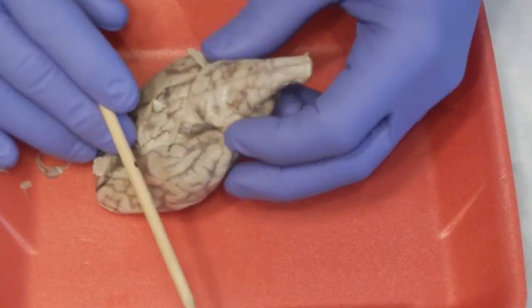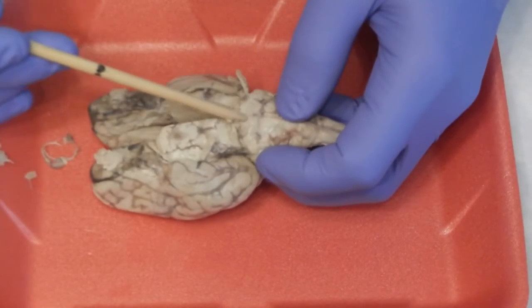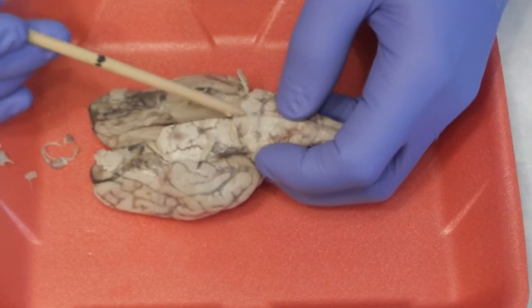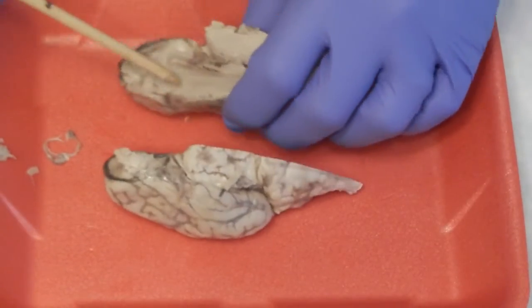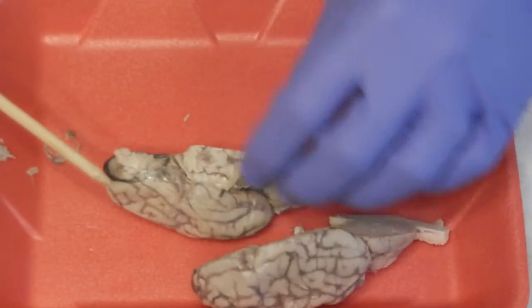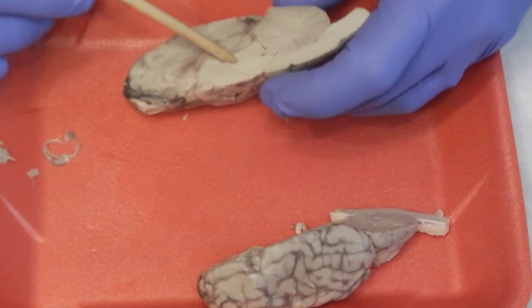And of course, if we look at this particular area, we'll have the spinal cord, which goes to the medulla, and then you'll see that there's a little prominence that sticks out, and that's the pons. Once we've actually done the cross-section of the brain, some of the other items will be a little bit easier to see. Sorry, I have to go through and do this on a different area.